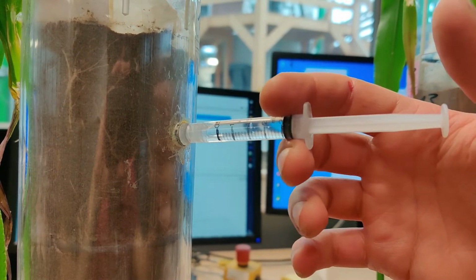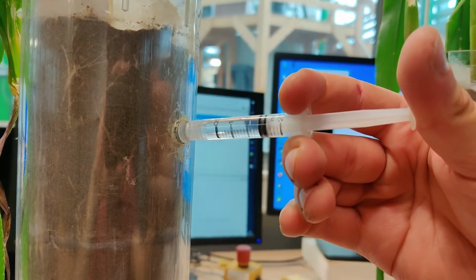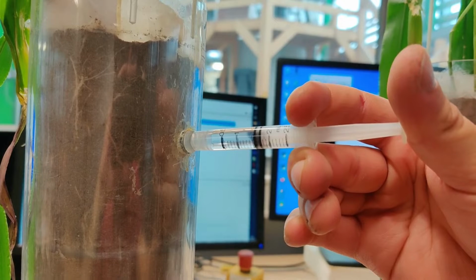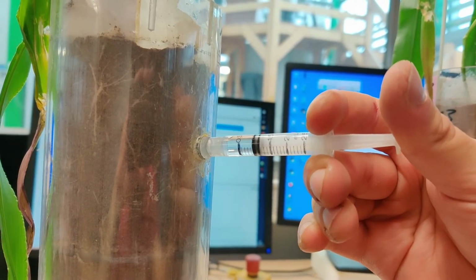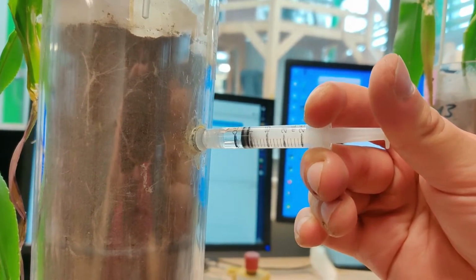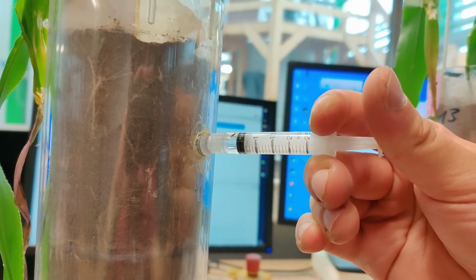In the treatments, layer 1 and layer 2 were the layers subjected to water injections. One layer received the first water pulse and the other layer received the second water pulse after the first one was consumed. The controls were kept at 15% volumetric water content in each layer for the entire duration of the experiment.